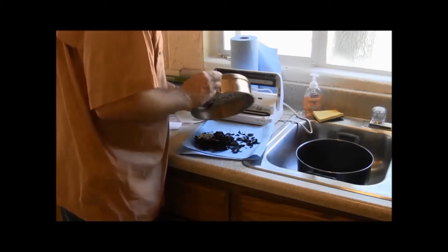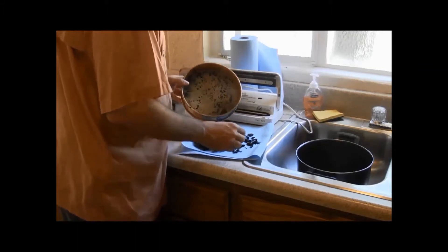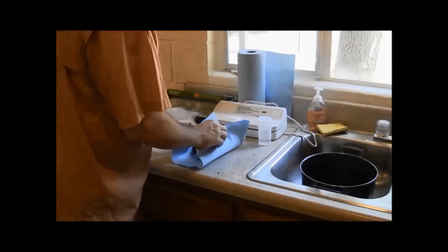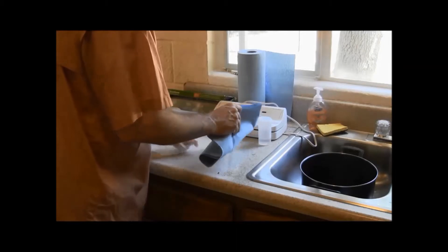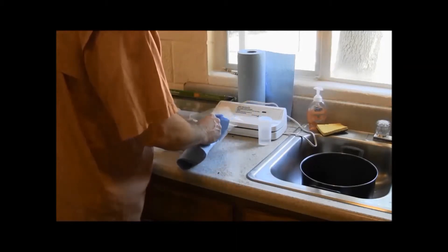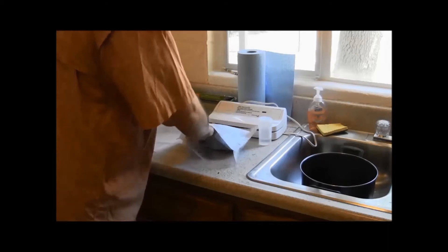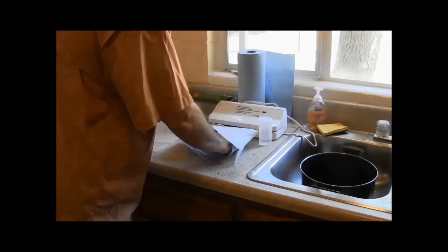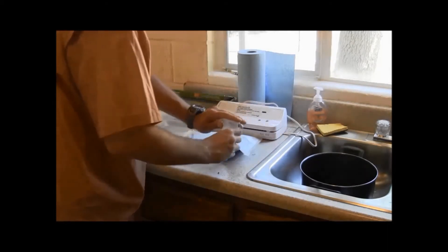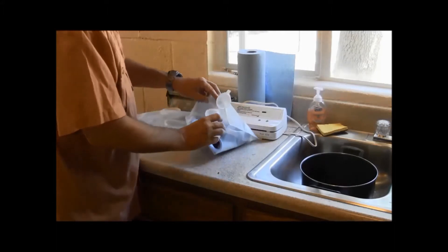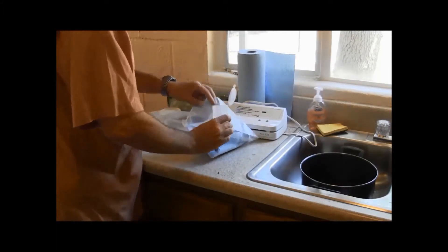Remove your sample from the sieve and place it onto paper towels. Gently wrap the paper towels and place your sample in the towels into a plastic bag that will be heat sealed. Then add up to 30 milliliters of 70% ethyl alcohol and heat seal the bag.